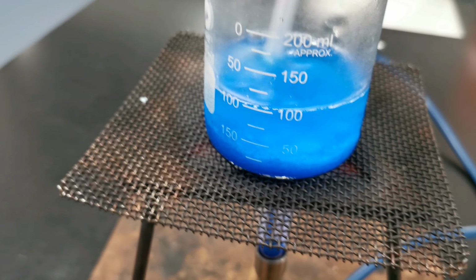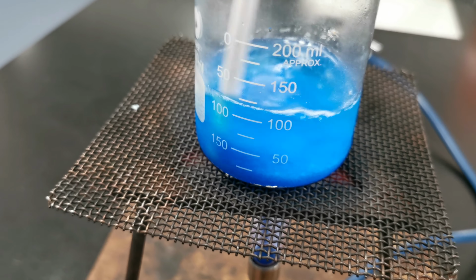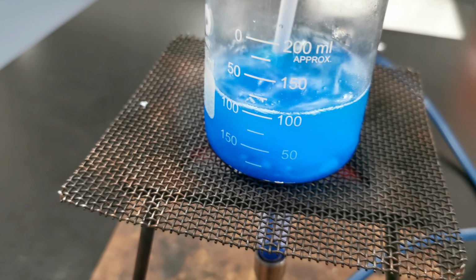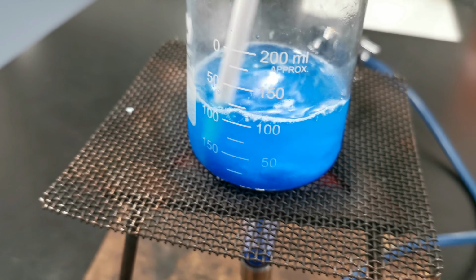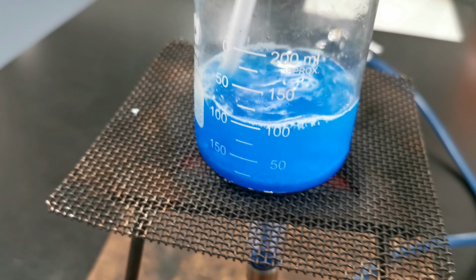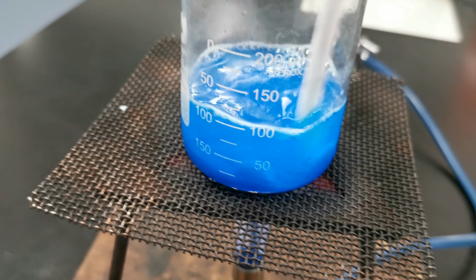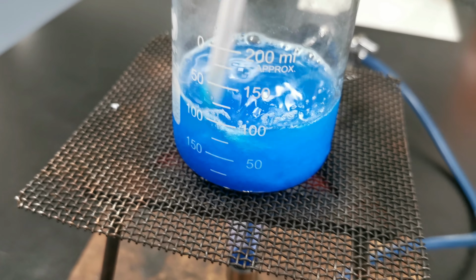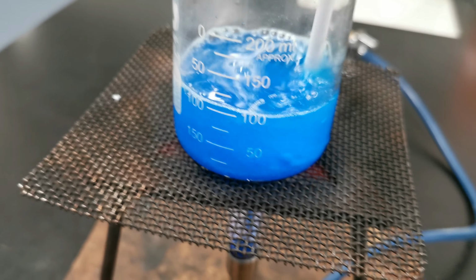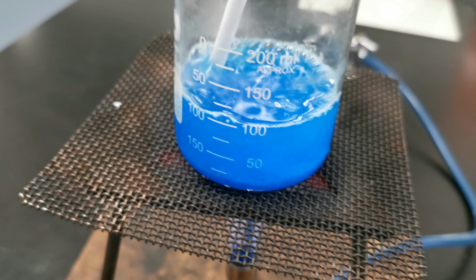Now, I did the math, and at 100 degrees Celsius, 75 mils of water will dissolve about 56 grams of copper sulfate. That's why I weighed that much out. It's about 56 and a quarter from memory. When I put this whole video together, I will show you how the math is done. We can actually hit a number of different science aspects with this prac.